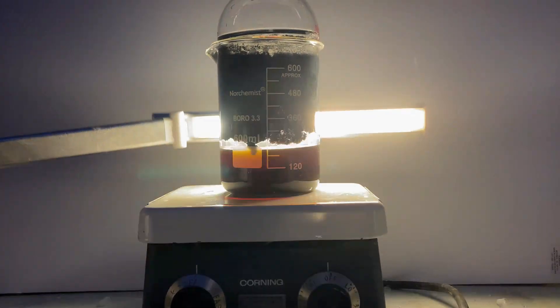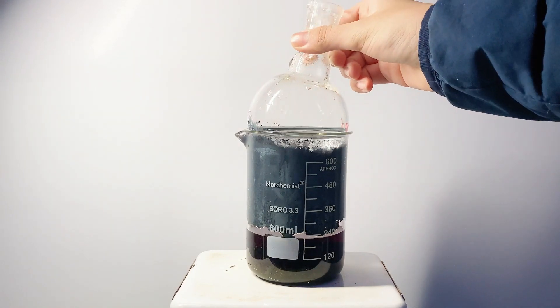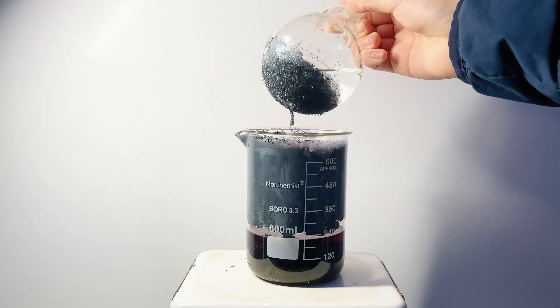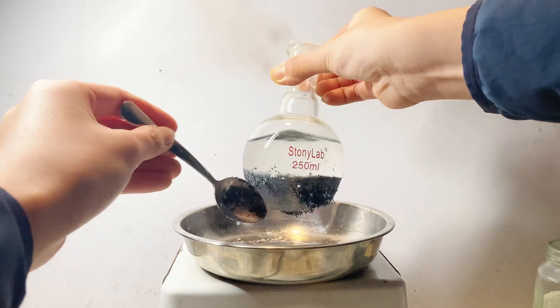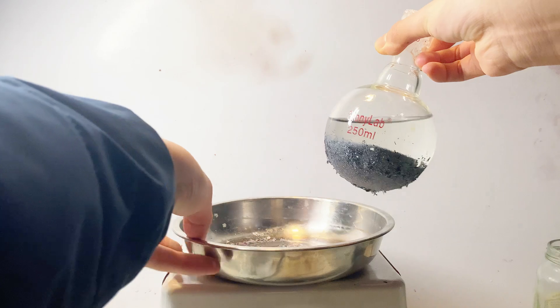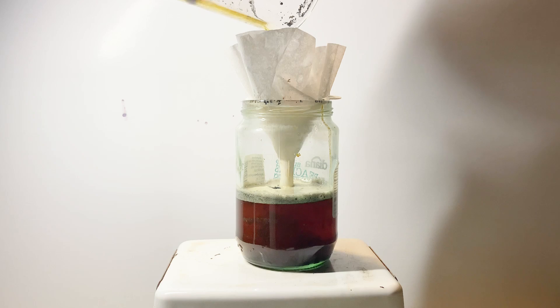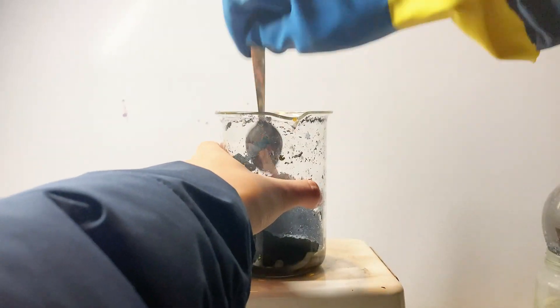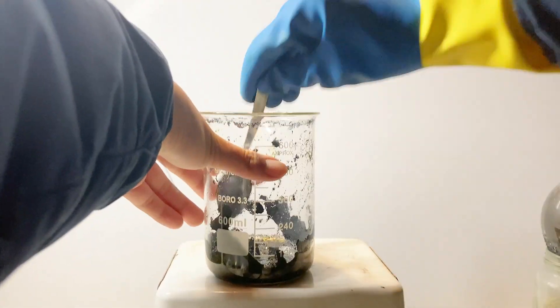As you can see, a bunch of elemental iodine has formed in the beaker, which has fallen to the bottom along with a bunch of water. The water is also slightly colored as iodine is sparingly soluble in it. Now in order to purify this iodine, I'm going to need to do a recrystallization, which I have basically already partially done by placing it on the cool round-bottom flask. If I take it off, you can see pure iodine crystals formed on it. So I scraped those off and let the beaker cool down. I then poured it through a coffee filter, which worked perfectly, and the small amounts of iodine left on the filter were transferred back into the beaker. After scraping off the iodine also condensed on the sides of the beaker, you can hopefully clearly see into the reaction vessel now.